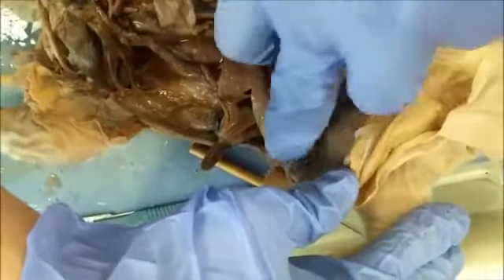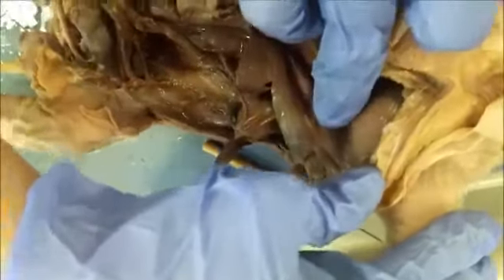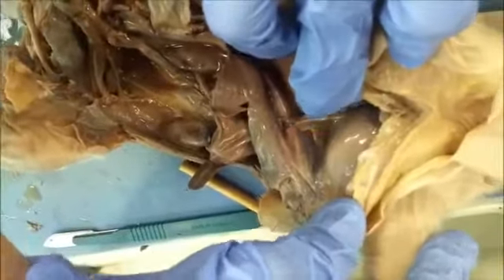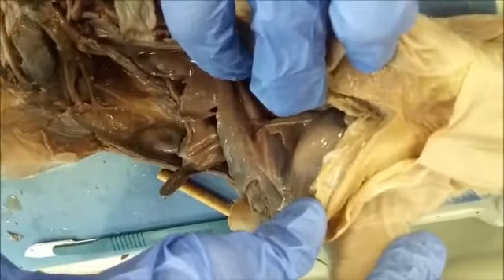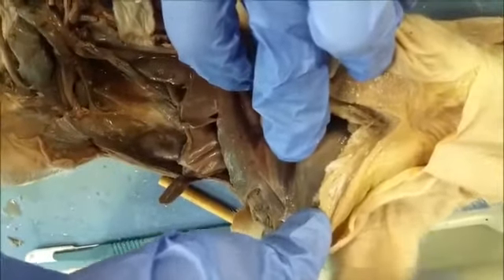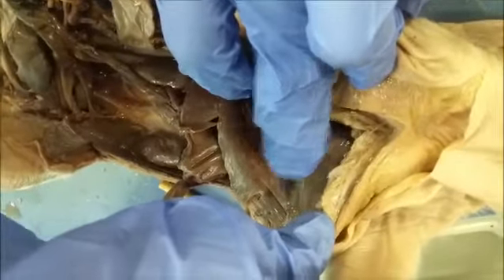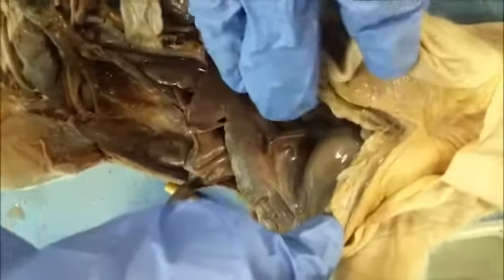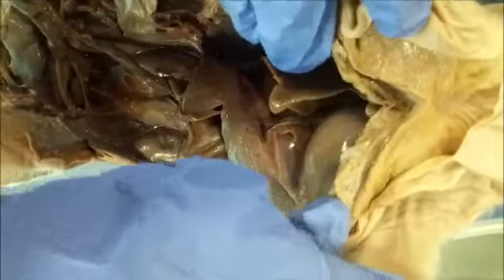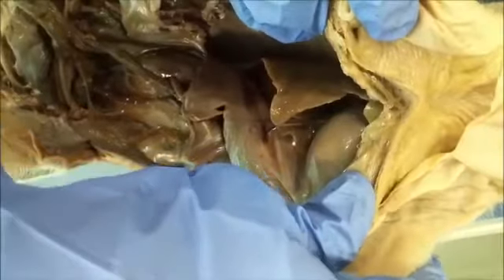As you can see here, surrounding the heart is another serous membrane, which is the pericardial membrane, the pericardial sac, and again its function is to reduce friction. There are both the parietal and the visceral; the visceral is the one that covers the organ, and the parietal is the one that covers the wall. They reduce friction and prevent the heart from becoming inflamed as it rubs against another organ, namely the lungs or the wall of the cavity.